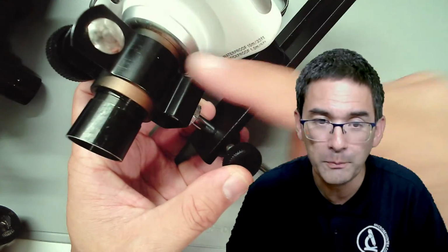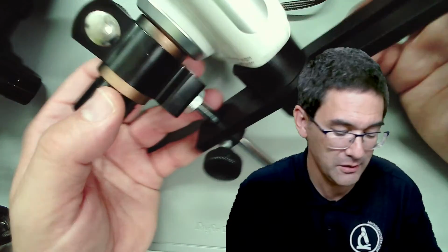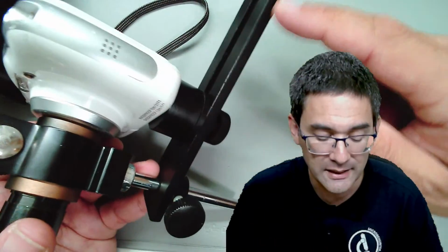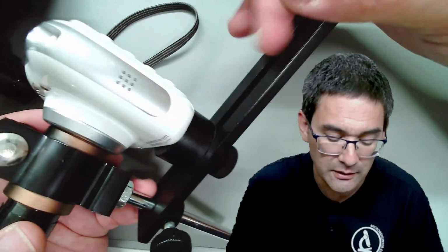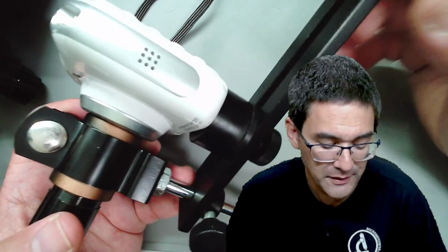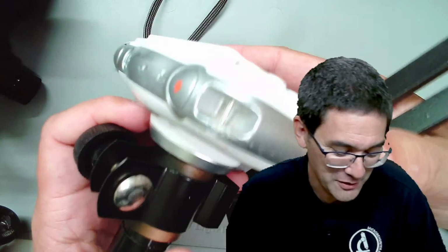But this is an interesting solution as well. There are not so many companies that actually make this, but I was thinking that maybe it's possible to make this yourself a little bit. It's not so difficult. I know that there are those brackets that are sold because photographers mount cameras on these, and flashlights and microphones and so on. So maybe it shouldn't be too difficult to make something like this yourself. So maybe that's going to be the contents of another video.